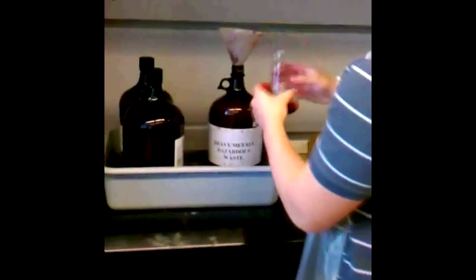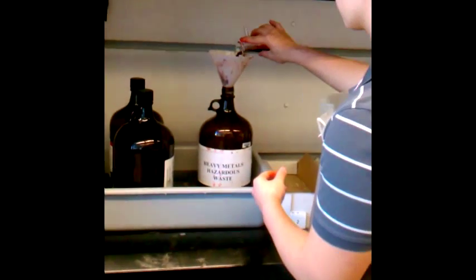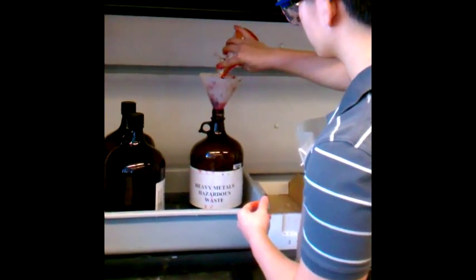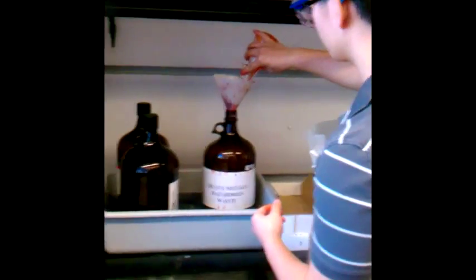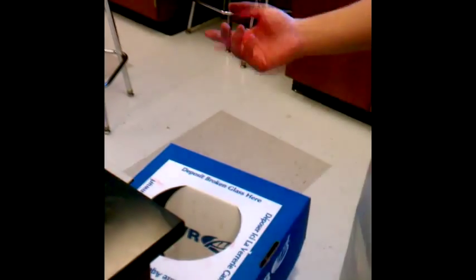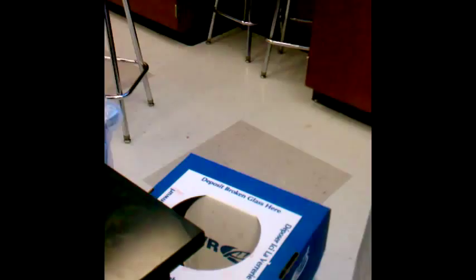Collect the excess solution in this experiment and pour this into a beaker. Record the volume, then pour the solution into a heavy metal waste container. Dispose of the disposable pipettes into the broken glass bin.